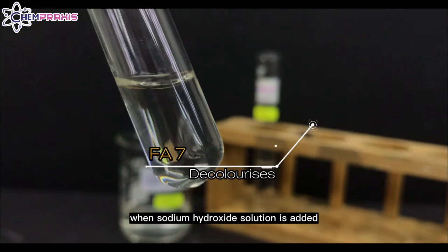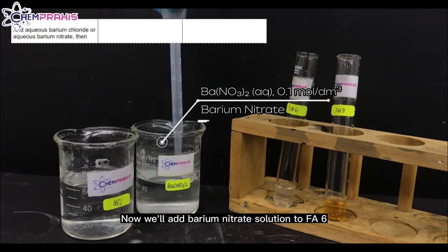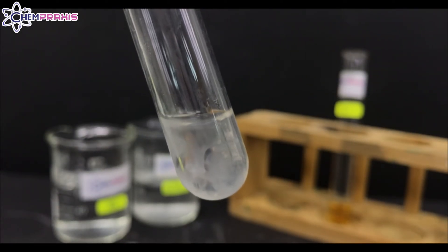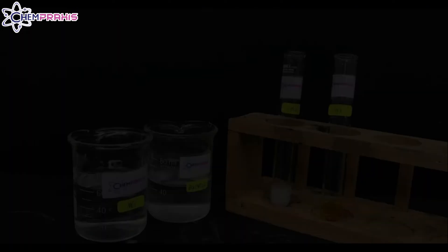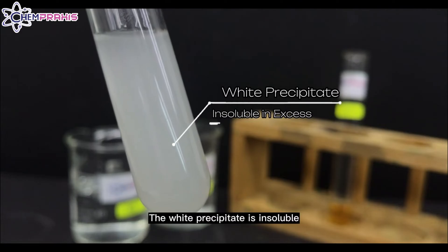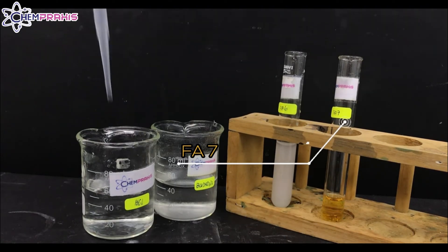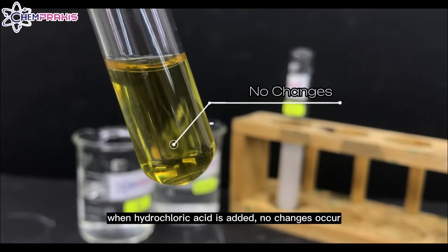When sodium hydroxide solution is added to FA7, the yellow color is decolorized. Now we'll add barium nitrate solution to FA6. When barium nitrate is added, a white precipitate forms. The white precipitate indicates that sulfate, sulfite, or carbonate ions might be present. Now we'll add dilute hydrochloric acid to FA6. The white precipitate is insoluble in dilute hydrochloric acid. Now we'll add some hydrochloric acid to FA7. When hydrochloric acid is added, no changes occur.